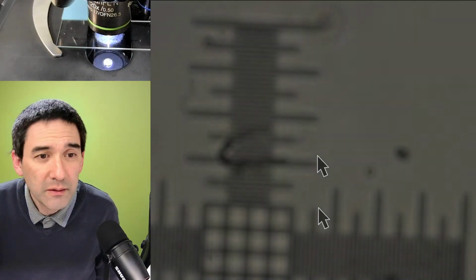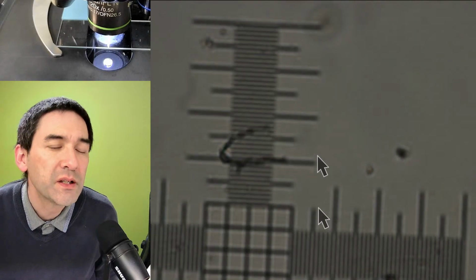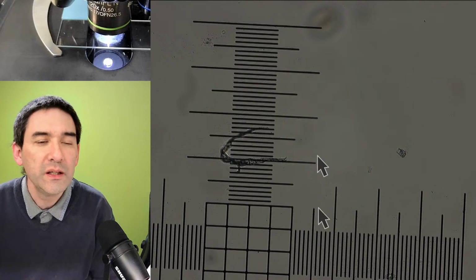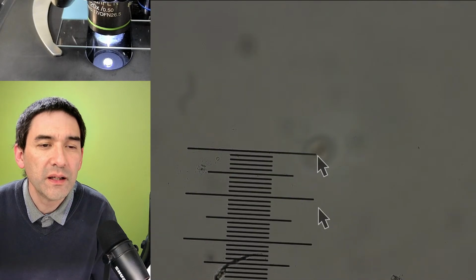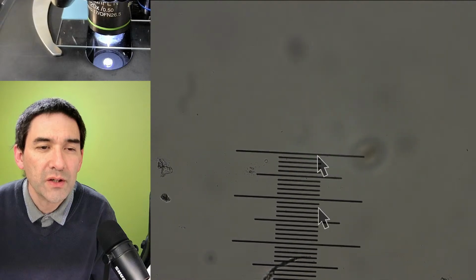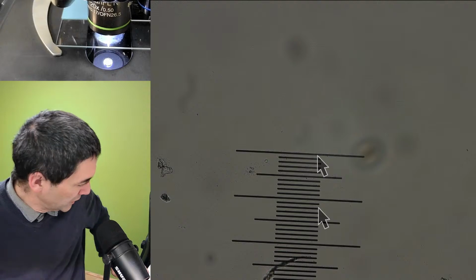1, 10, 20. Let's get this whole thing into focus. So one division is 10 micrometers. So how many divisions do I have? Okay, let's do the following.